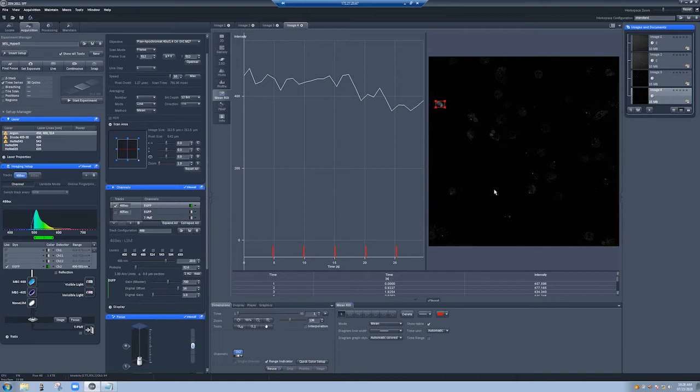So let me show you one more thing, which is how to do this kind of experiment over multiple positions. So this is frequently something that we need.